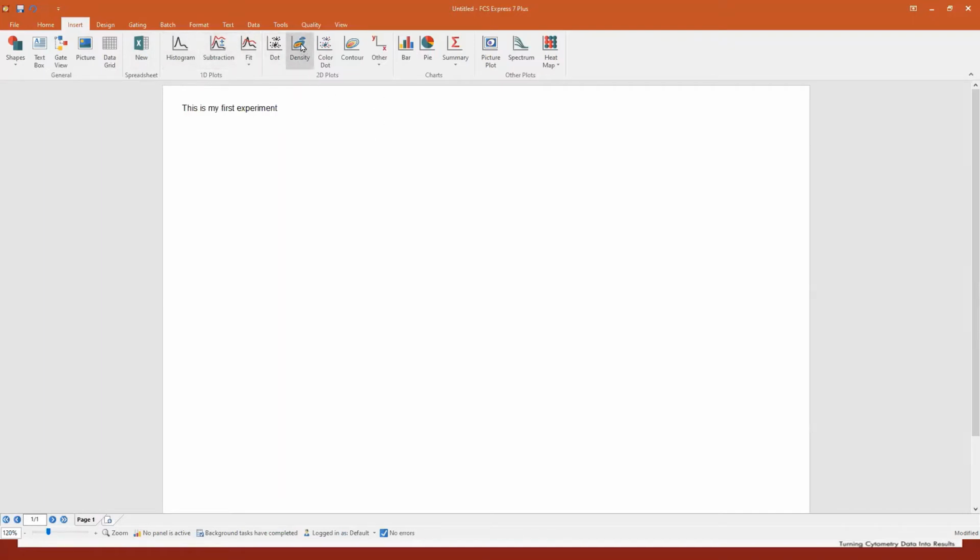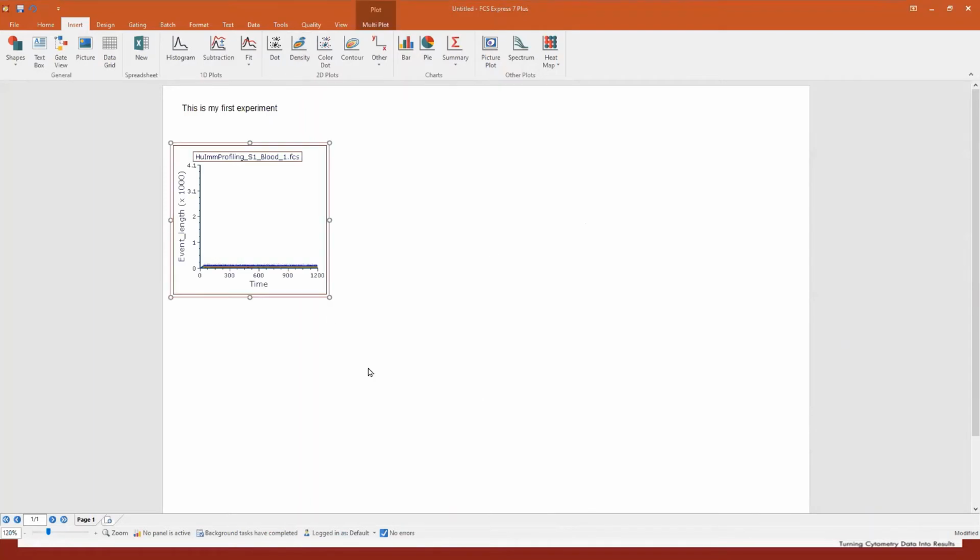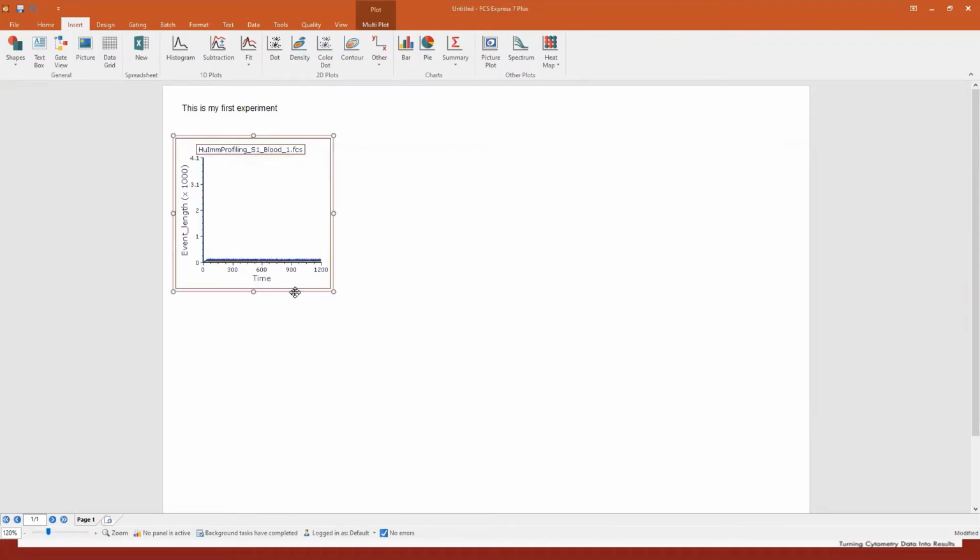For example, if you want to create a density plot, just click on density and draw it. And now the software is asking me, well, Andrea, which file do you want to load? You see here, I have a bunch of files. Those are total blood, of medium size, 250 megabytes. I will click on open, and now the file is loaded. Now, this is not a picture, it's a plot, it's an interactive object. So I can resize it, I can move it around if I want. And of course, if I click on the axis, I can access all the parameters saved by the machine. And you see, it's a long list.